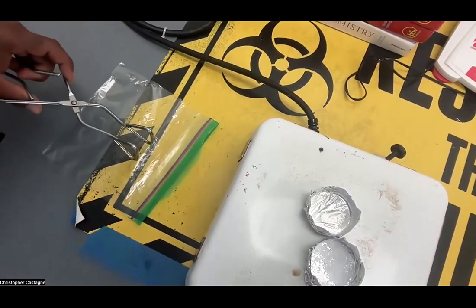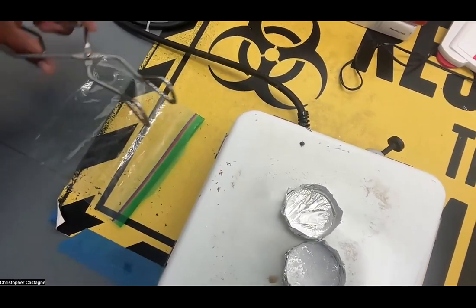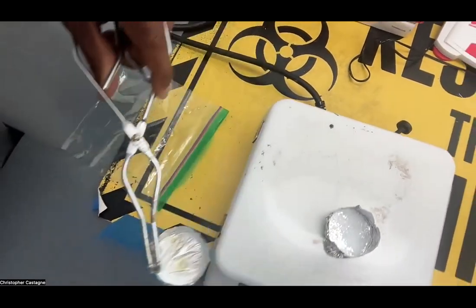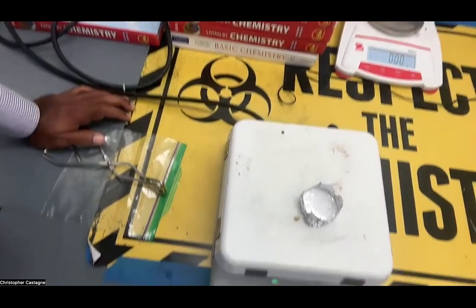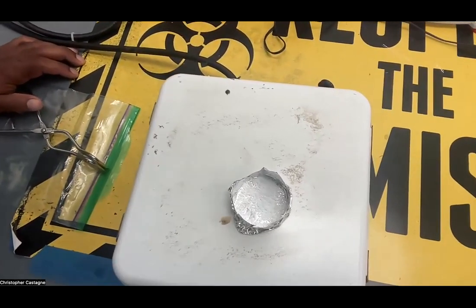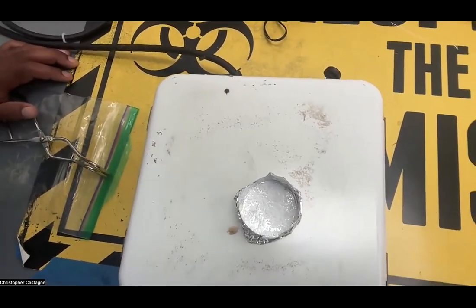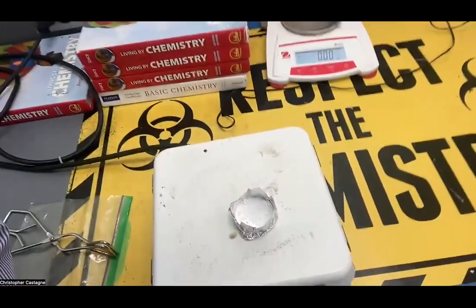Compare that to substance A, which at this point has clearly started to melt — it's almost all liquid. It's starting to turn color a little bit, so I'm going to take it off. That means a chemical change is about to start. It's been about three minutes, three and a half minutes. Substance A has just melted. Substance B melted after one minute. Substance C fizzed for a bit, has stopped fizzing, and is still solid — substance C did not melt.